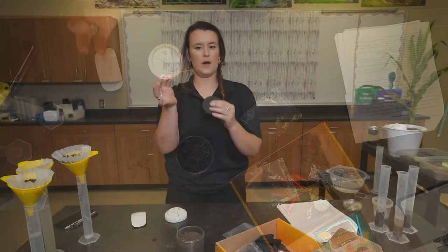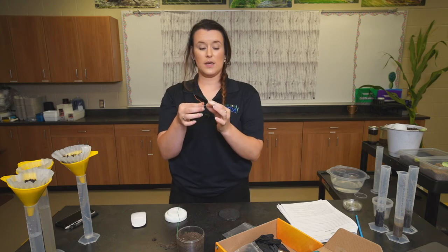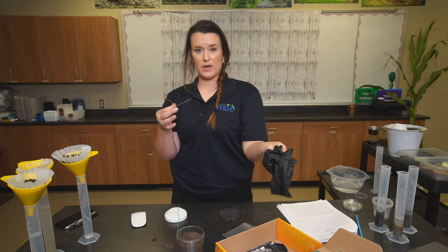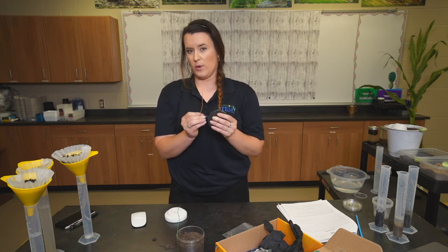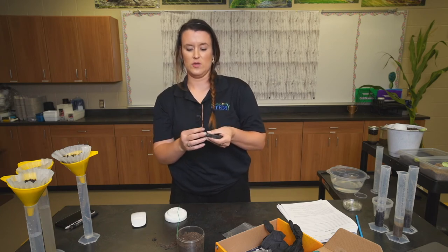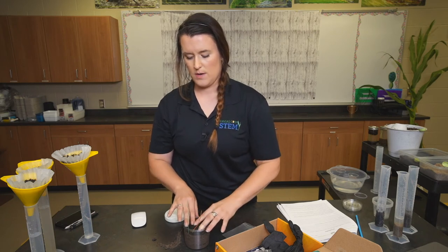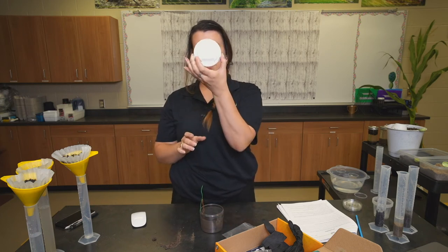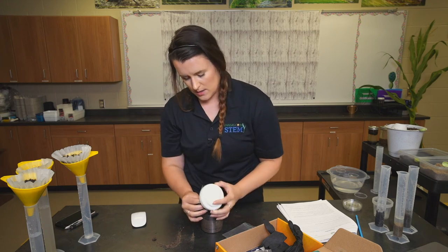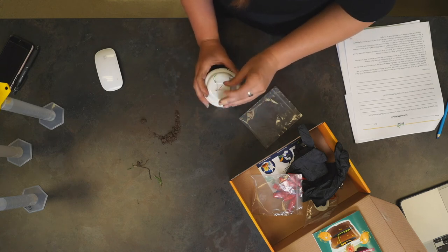Pick up the cathode — it has the orange wire, and the same setup, except the graphite pad is larger so the wire is easier to insert. Bend it to an L shape. The instructions say you can wear nitrile gloves; if you don't have enough for all students, you can still get good results without them. Place the cathode on top with about a centimeter's worth of air pocket remaining. Take the airtight sealing lid — it has two holes in the front — and slide both wires through as you put the lid on. It's okay to bend them slightly as long as you don't accidentally pull them out.